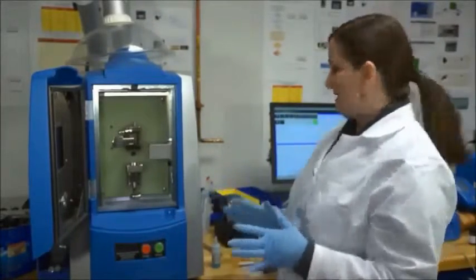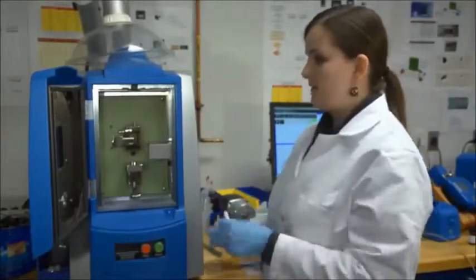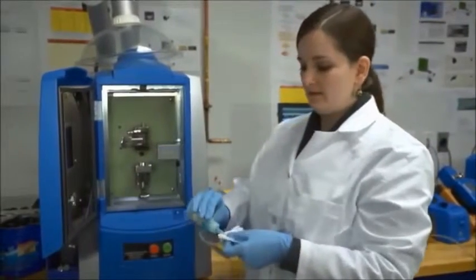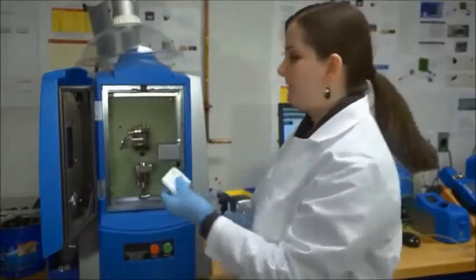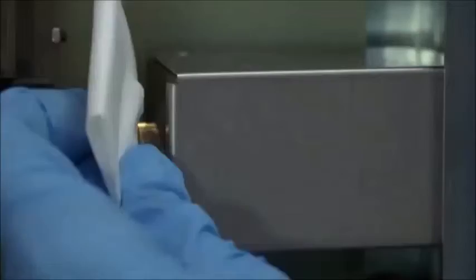Before each analysis, you want to make sure to clean the lens. I'm using some window cleaning solution on a clean chem wipe, and I just gently wipe the lens.